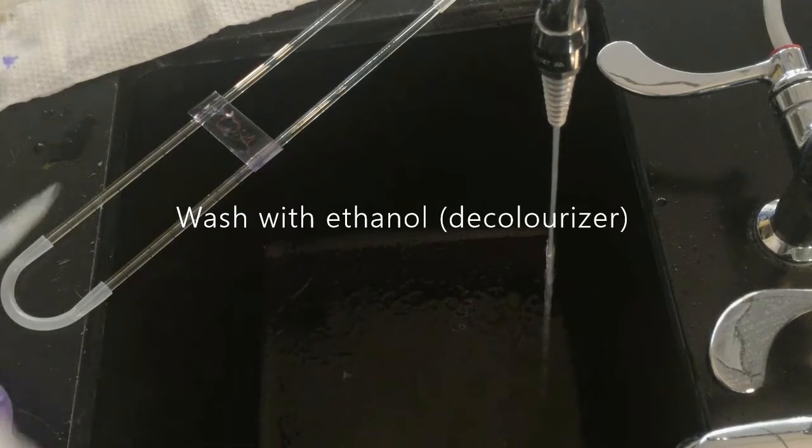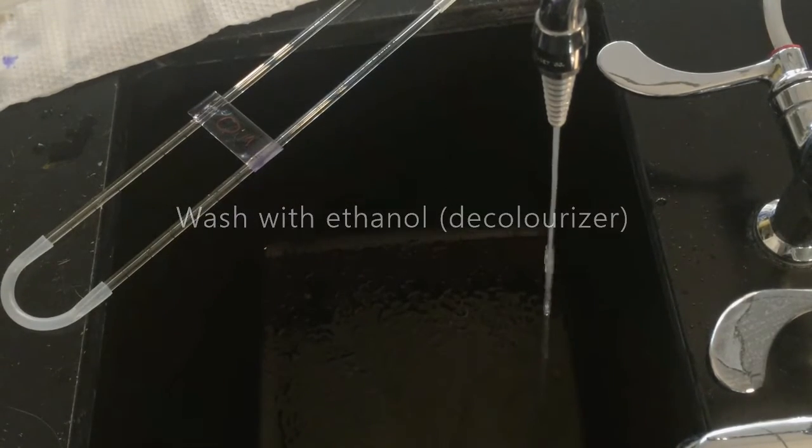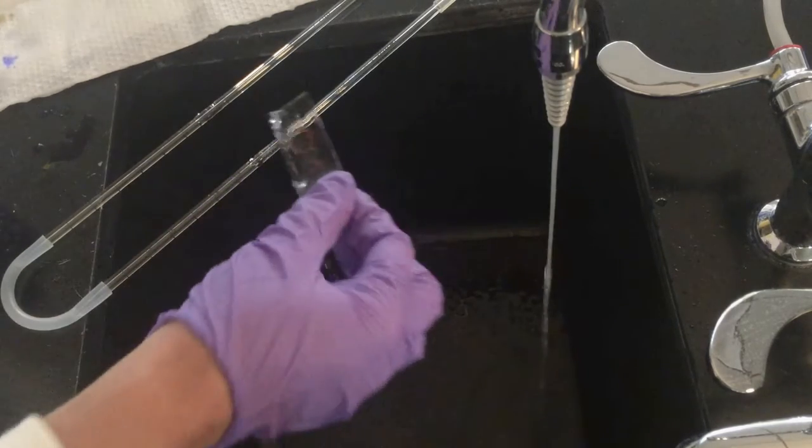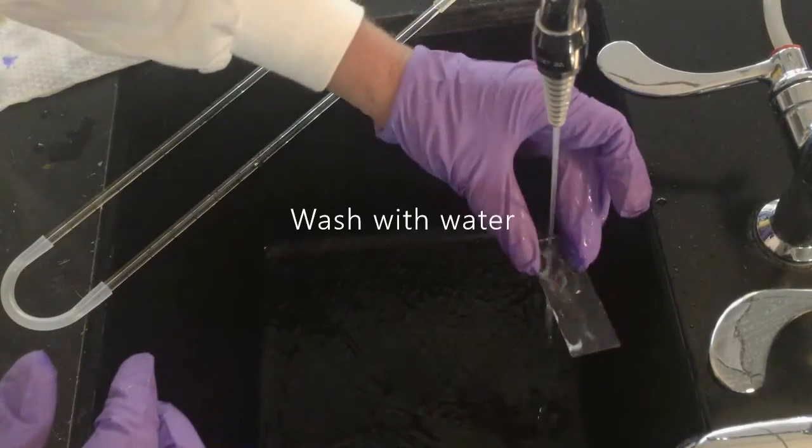I'm going to add the ethanol on there. I don't want to leave it much longer than about 20 seconds. At the end of 20 seconds, I let the ethanol come off and give it a quick rinse.